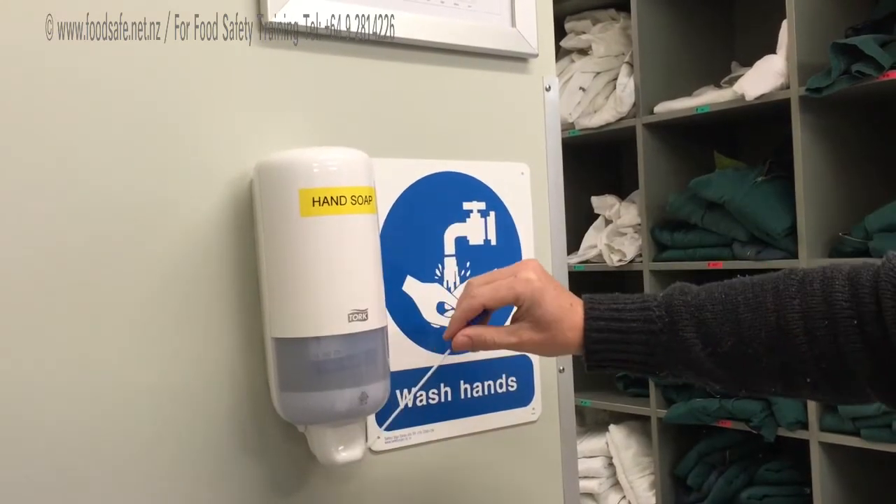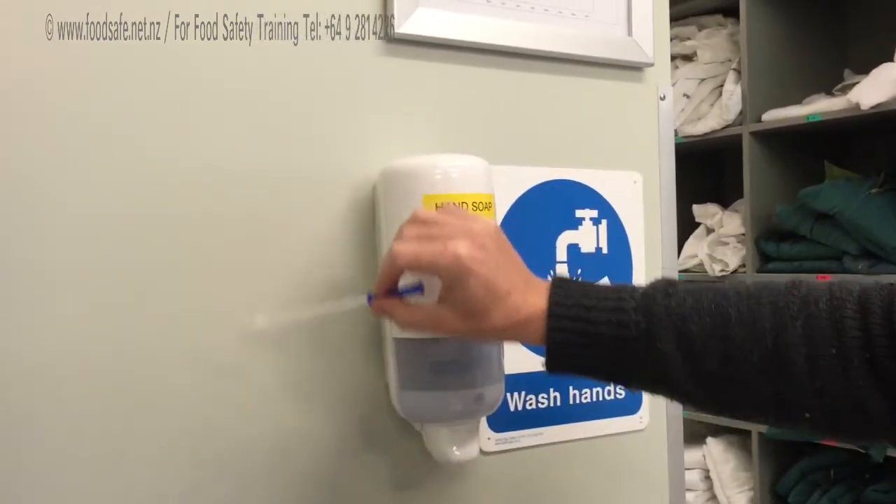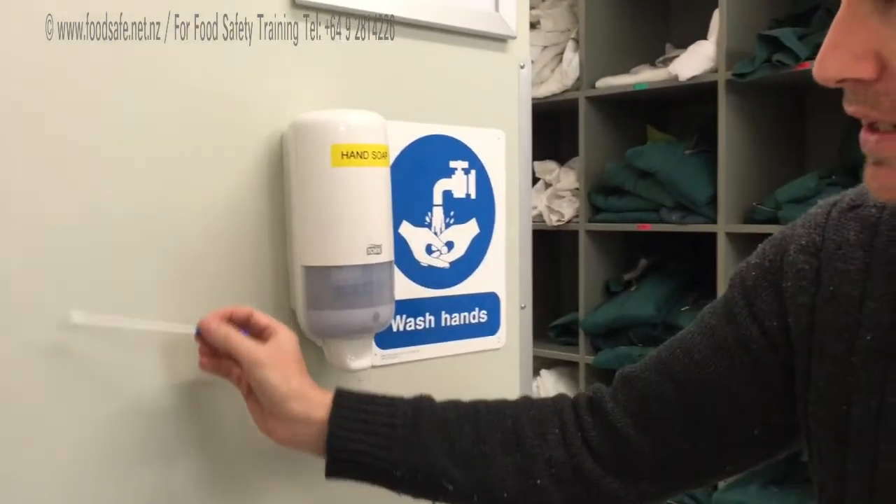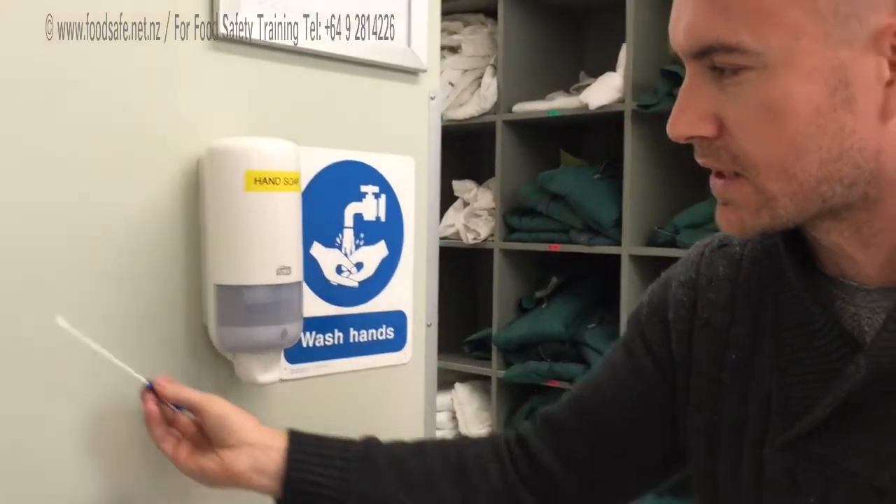All through that kind of area. You kind of want to cover a 10 by 10 area. If you can get a nice flat area, smooth it around each way, back and forth, keeping it nice and flat, rolling through it.